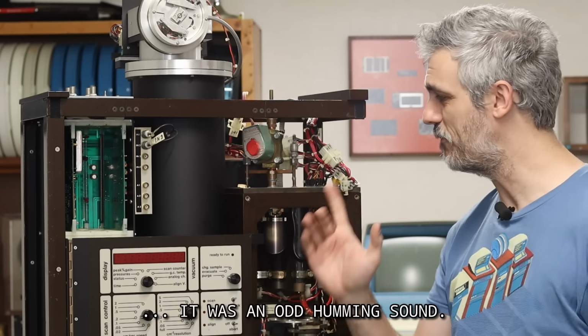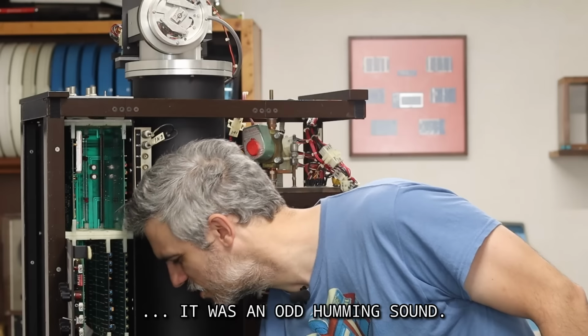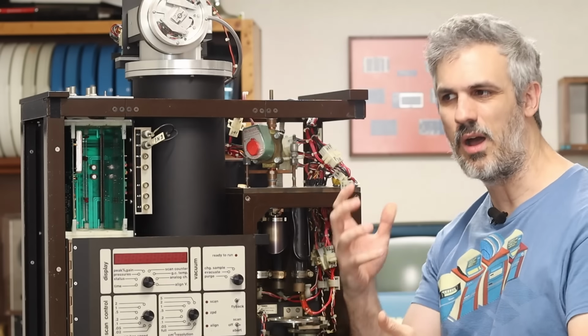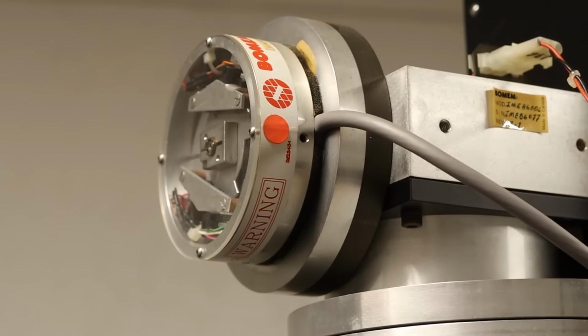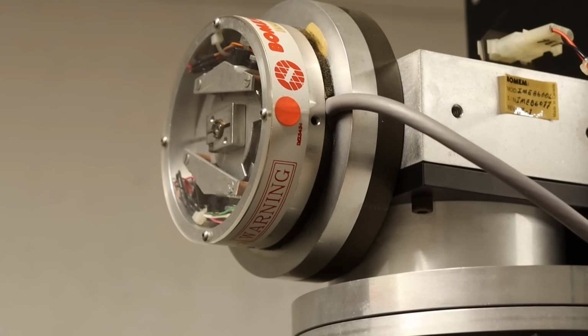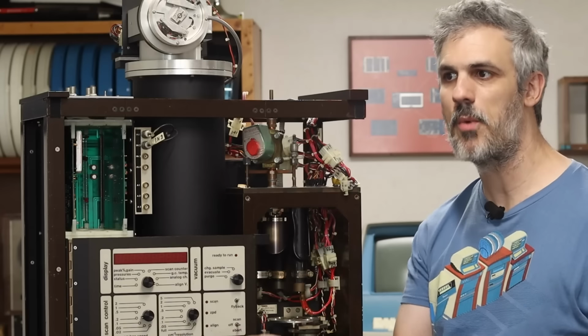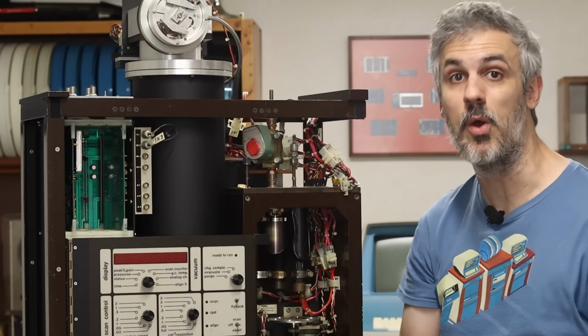So let's break that down. The sound that I was hearing was coming from the tube. If I opened this up and held my ear to the tube, I could hear that humming sound going on. And that sound was the motor up here holding the mirror in a set position. So good news, the motor is now powered, but how come the motor isn't causing the mirror to move up and down like it should be when we're in mode 3?